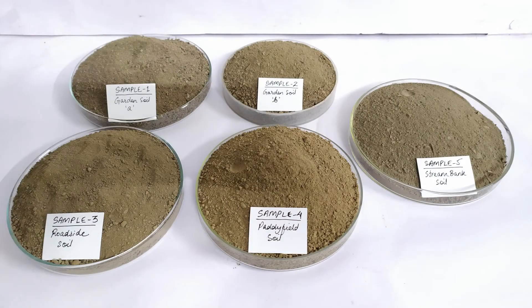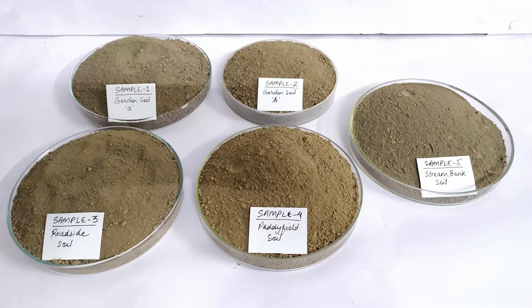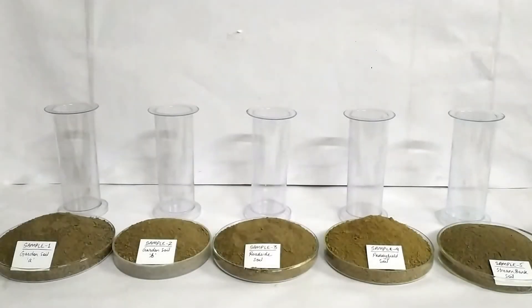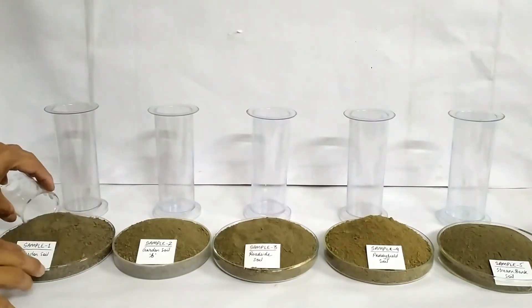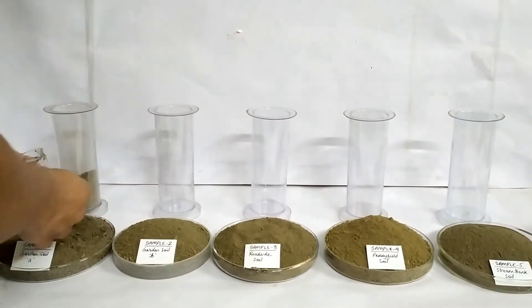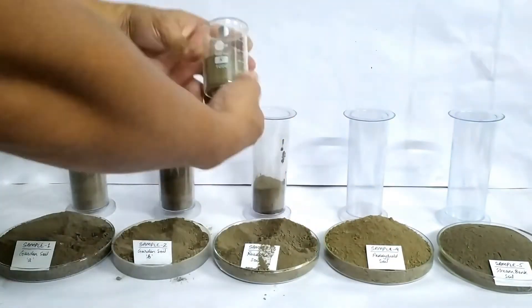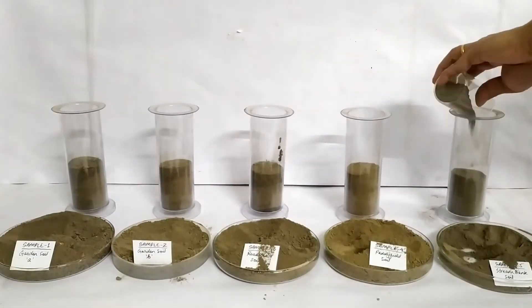Take five air-dried and preferably powdered samples of soil in different containers and label them appropriately. Manually remove any large pieces of plant and animal debris and stones from each sample. Now take five identical graduated cylinders or gas jars — gas jars are being used for this experiment. Introduce approximately equal amounts of the five soil samples into the five jars such that almost half of each jar is filled. Label the jars appropriately.